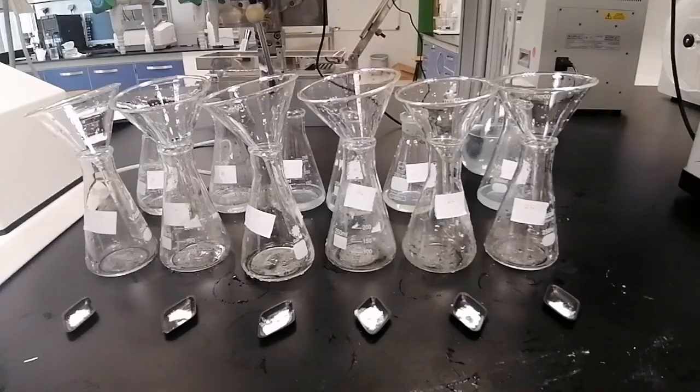We will use ethanol here. We can use other solvents like propylene glycol, glycerine, or polyethylene glycols, abbreviated as PEGs. Here we will study the effect of different concentrations of ethanol on the solubility of mefenamic acid in aqueous solution. We will use a phosphate buffer of pH 7.4, the same one used before in the first part of this experiment, simulating the blood media and its pH in our system. And we will use ethanol in different concentrations.